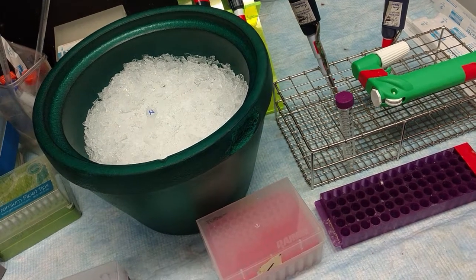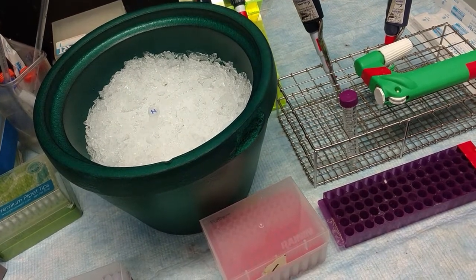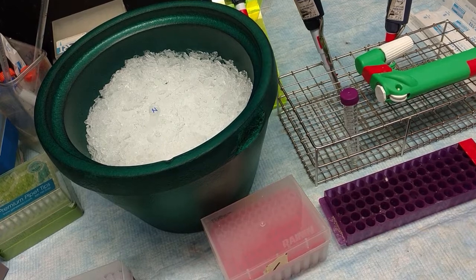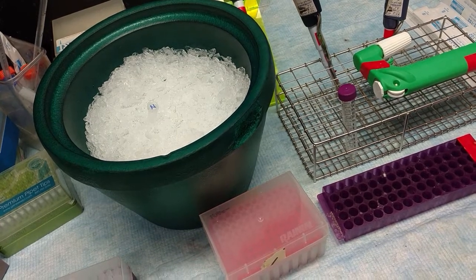This is the DNA extraction procedure for phage hunters, the new DNA extraction procedure, 2016 on.